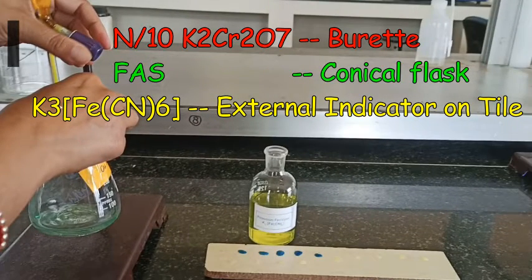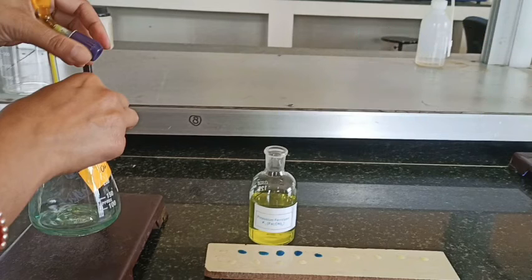So here we are going to titrate this ferrous ammonium sulphate solution against K2Cr2O7. And this is our external indicator, that is K3[Fe(CN)6], which is first placed on the glaze tile. While we are titrating, we dip a glass rod into the solution and then mix that solution with the already spotted external indicator, K3[Fe(CN)6]. If it gives Prussian blue, then this indicates that the endpoint of the titration is not reached yet. And if it doesn't give any color with the external indicator, then that suggests the completion of the titration.